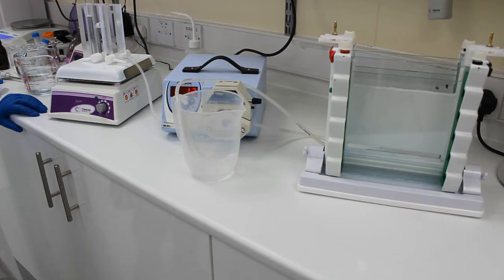So what we've done is we've poured some water into the second well of the gradient mixer and we're going to leave the pump running. The pump's going to flush water through the system and get rid of all that unpolymerized gel to make sure it doesn't polymerize within the tubing.